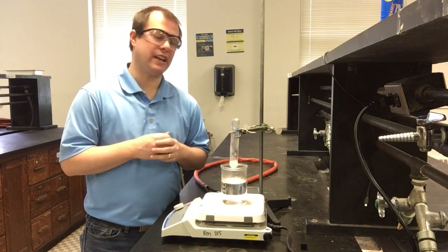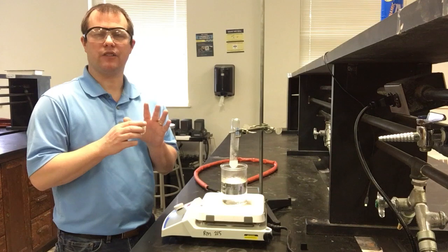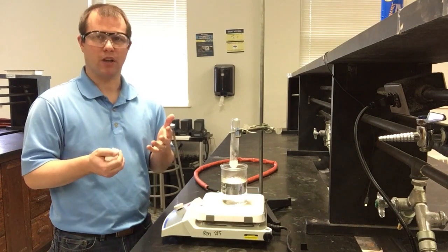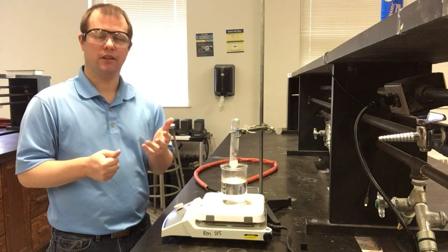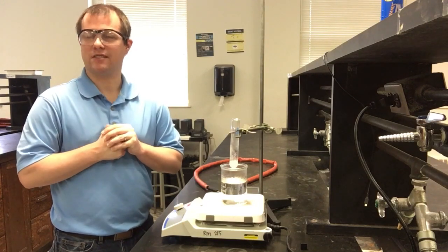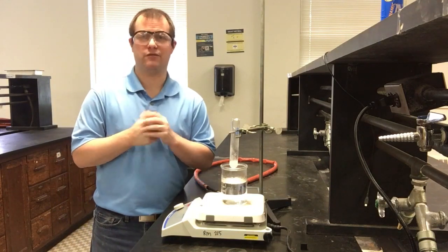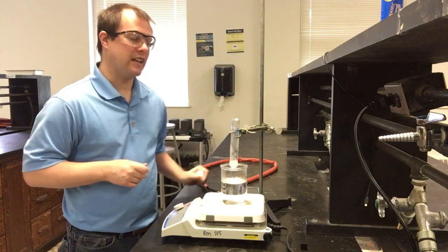This week we're going to be taking a look at our molar mass lab. Really what we're going to be doing is examining this idea of freezing point depression. We're going to be doing that for naphthalene, which thankfully you can count yourselves a little bit lucky that maybe you're not doing this lab in person, because naphthalene is what makes up mothballs. So you actually get to skip a full afternoon of smelling like mothballs after doing this lab.